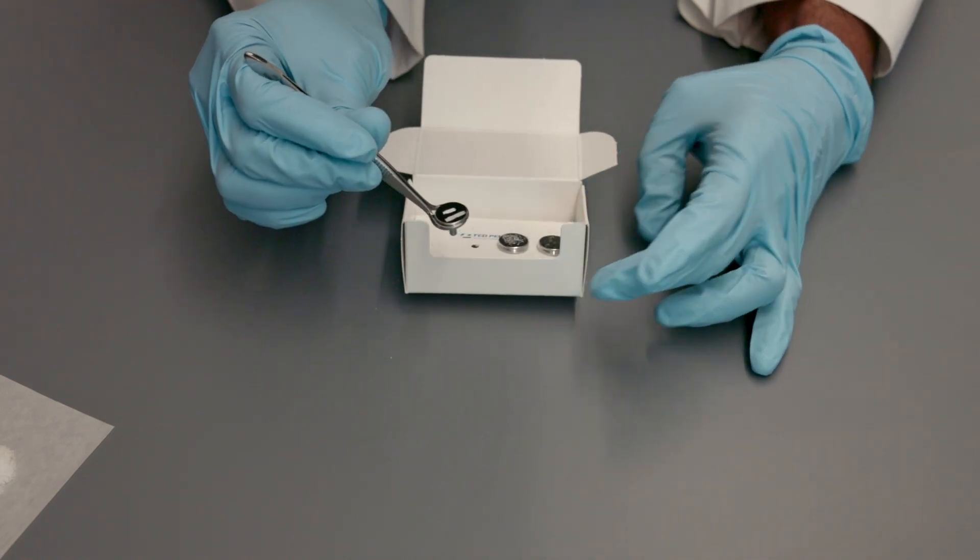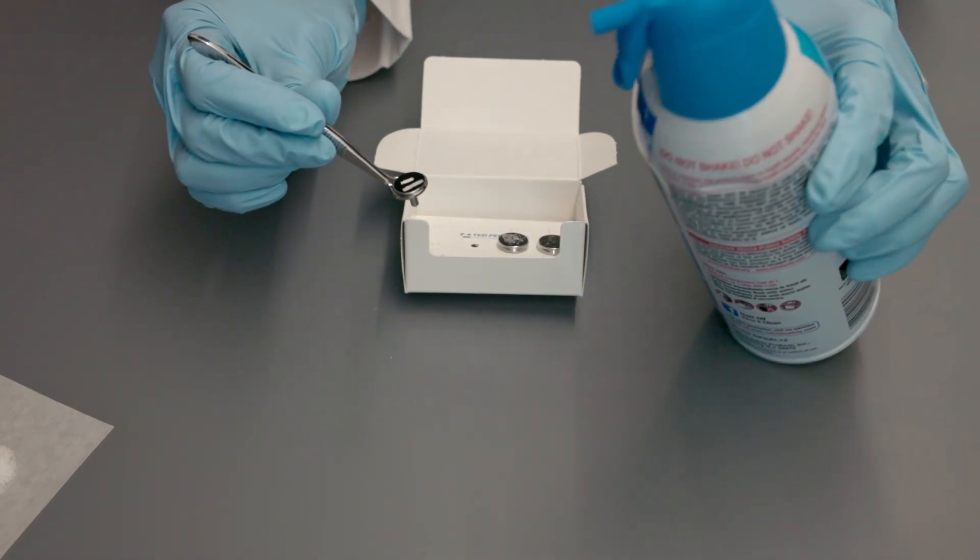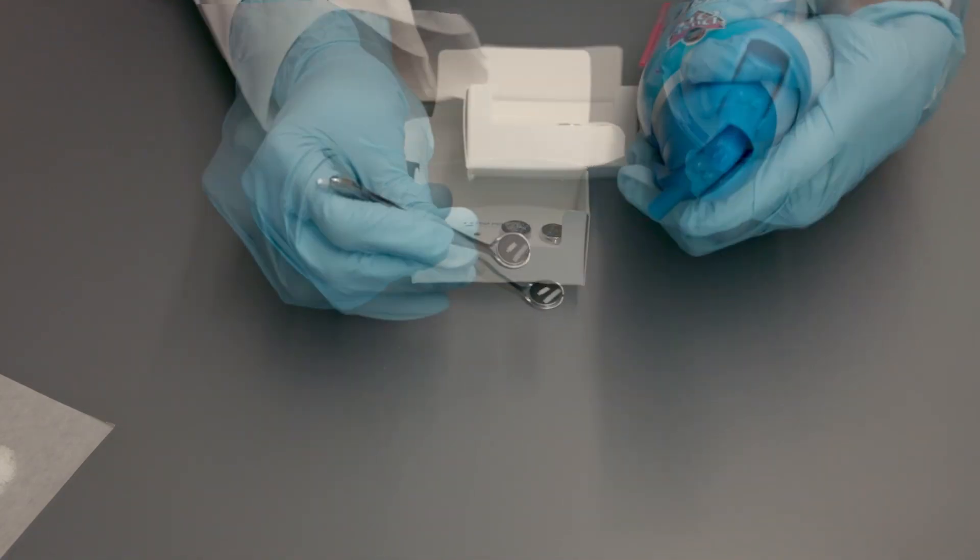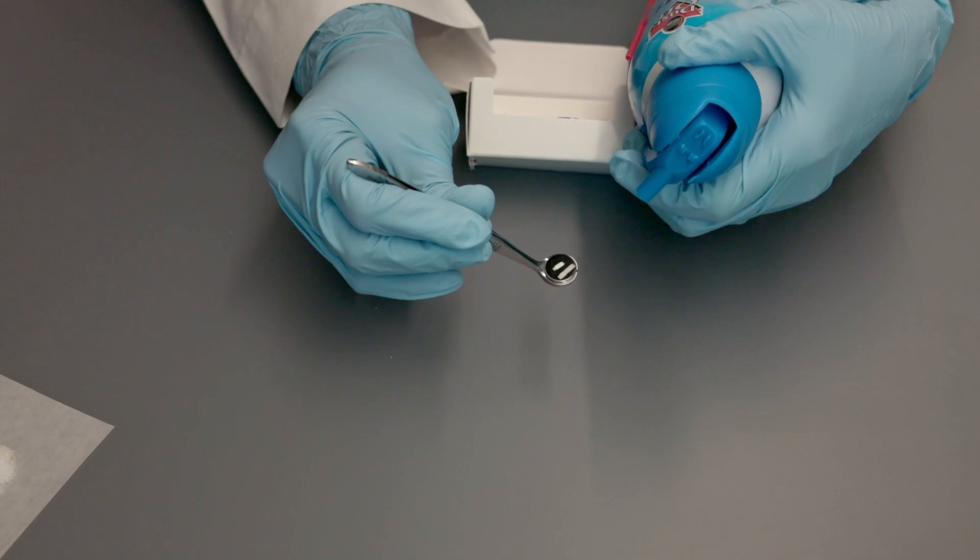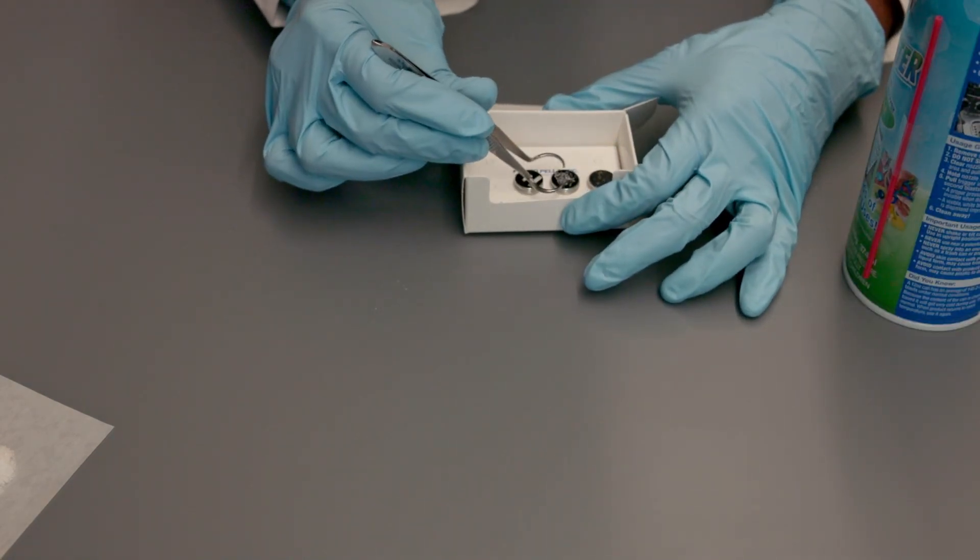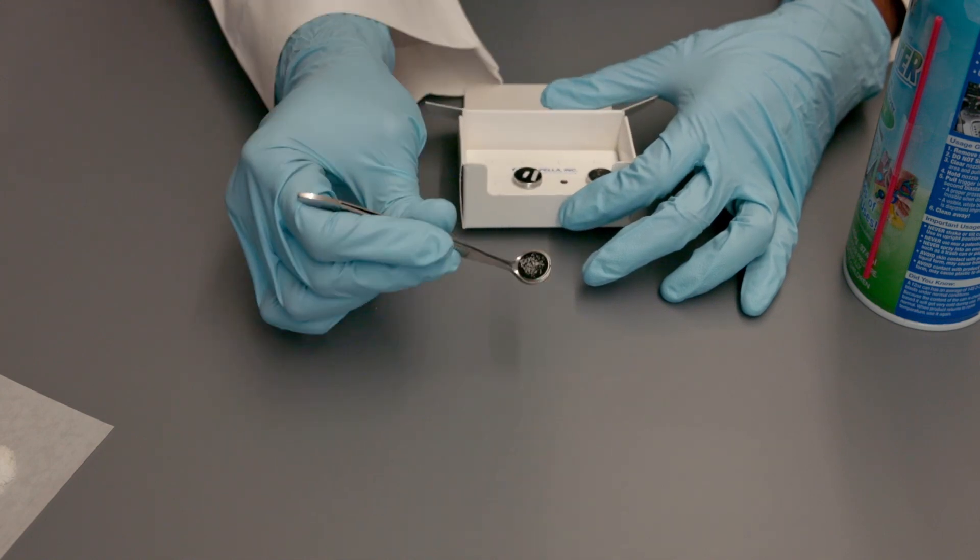The most important part is to ensure that there are no loose particles. We do this by blowing on the sample with compressed air. Give a couple of puffs to remove loose particles. We will do the same with all the samples.